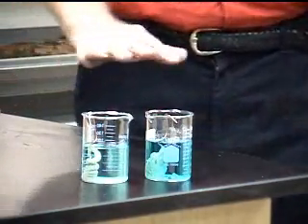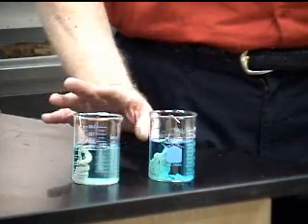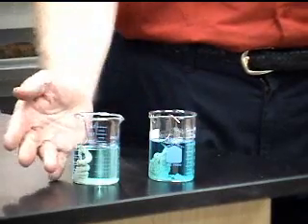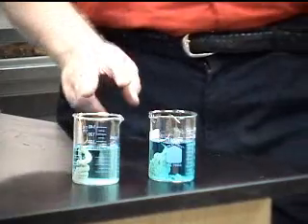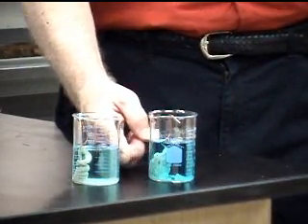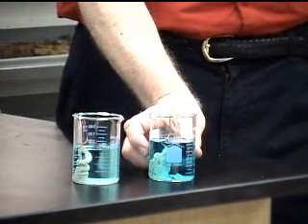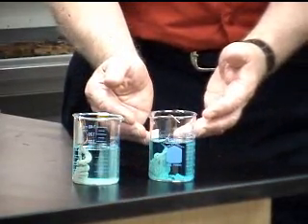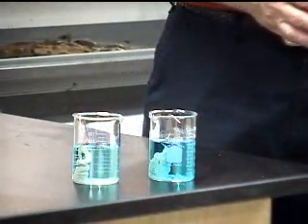Okay, here we are two days later, and you can see that a reaction has occurred, that silver is indeed around the copper coil. The copper has dissolved into solution, but there's a difference between the two. You can see one is much darker, one has a lot more silver in it than the other. The darker blue is where we added the 1.67 grams of silver acetate. So more silver has gone around the coil and more copper into solution, giving the darker solution.